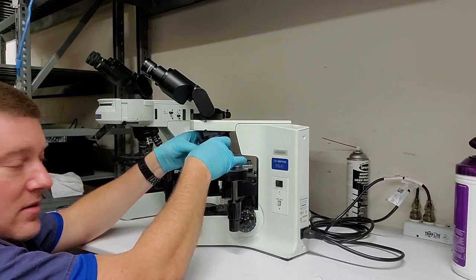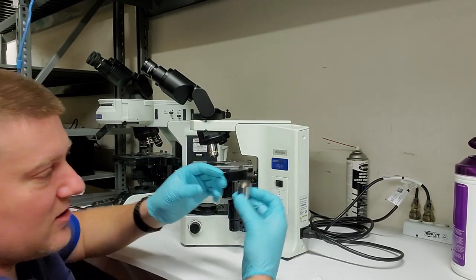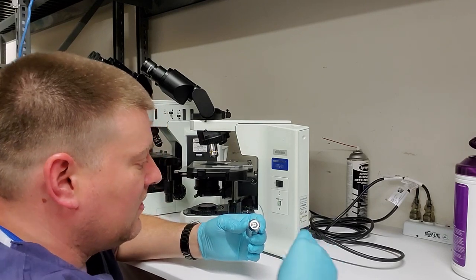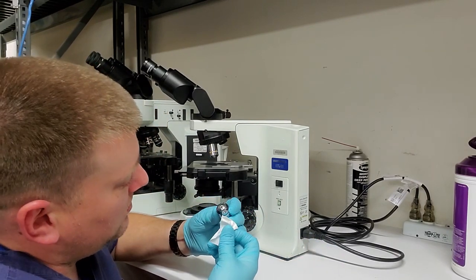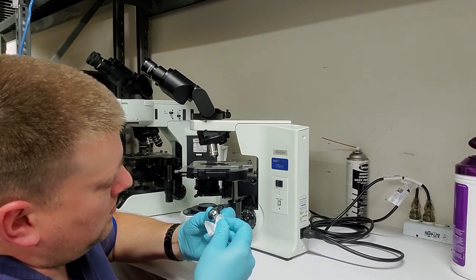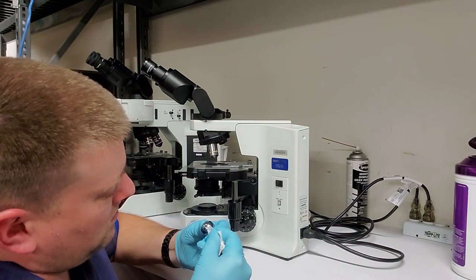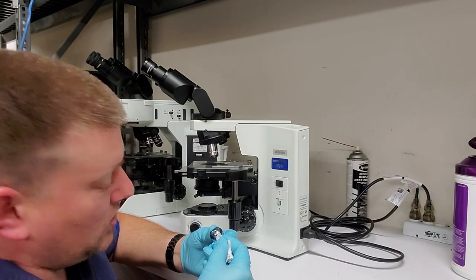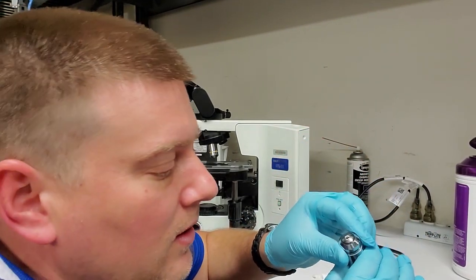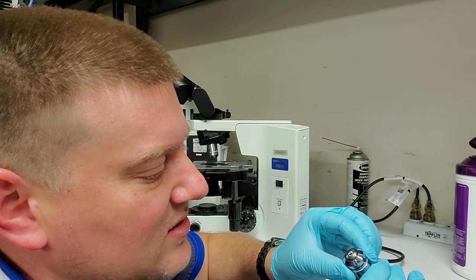Now I've got one hand beneath it and one hand unscrewing it, so don't drop it down on the stage like that. This one here is kind of big, it's kind of heavy, and I can see that it's got a lot of scratches on the brass. So same thing, do a quick scrub, and then we're going to do a slow one. Ooh, and this guy was dirty. Beautiful. So this is a tiny, tiny aperture on this objective, okay? And there was some goo on there. And that will show up. It'll limit some of the light that's reaching the doctor's eyes.